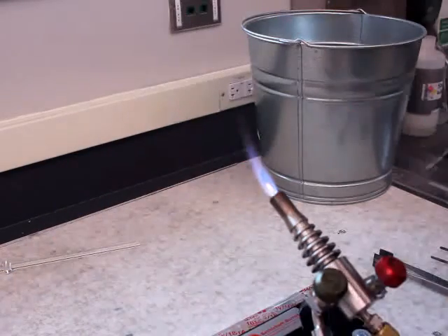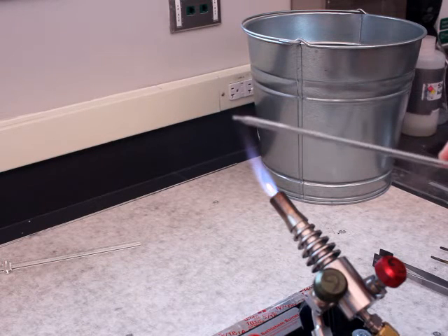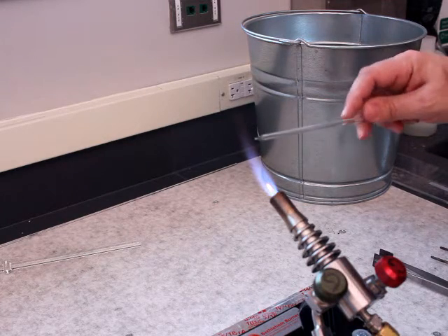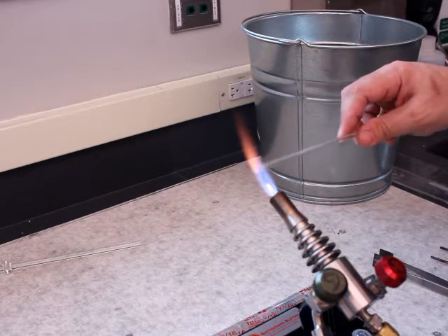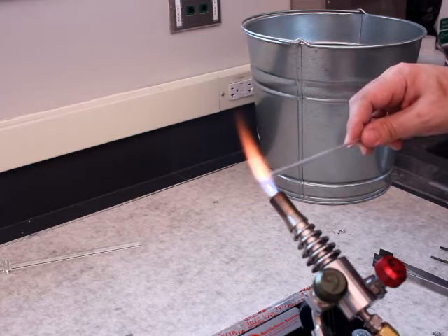I'm going to switch hands now. The reason why is I've got kind of a weird looking end for the glass rod, but that's okay because this is why we do the practice of the gather with the ball of honey. So now I go back into the flame and heat up the very end of the rod.